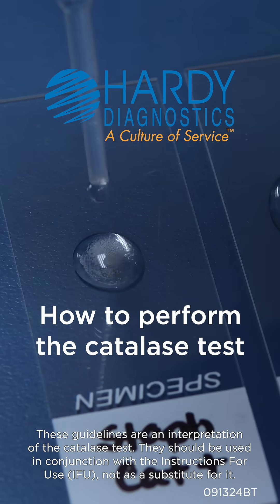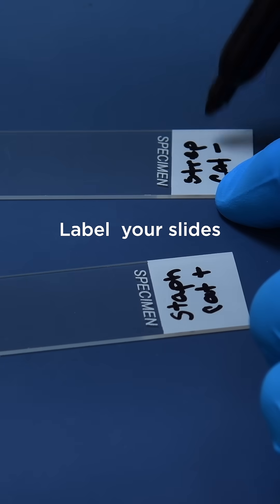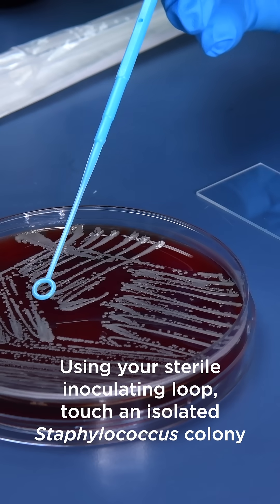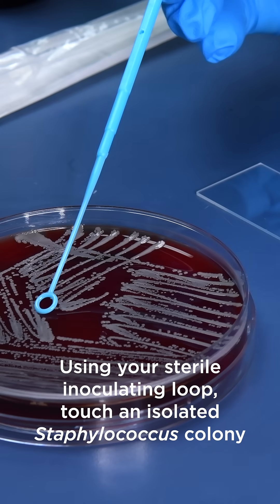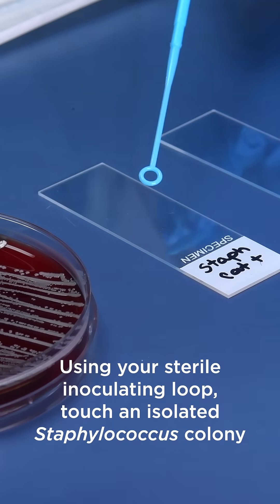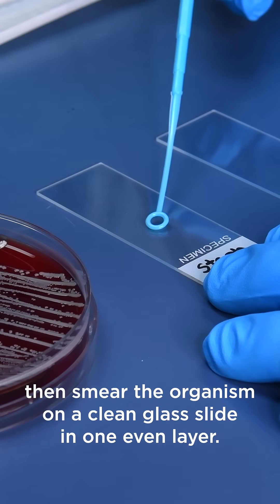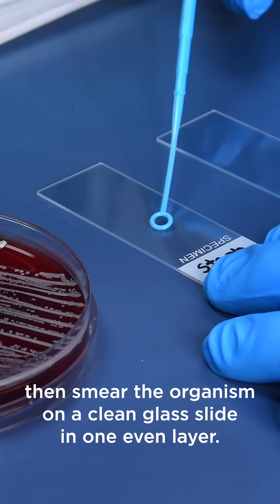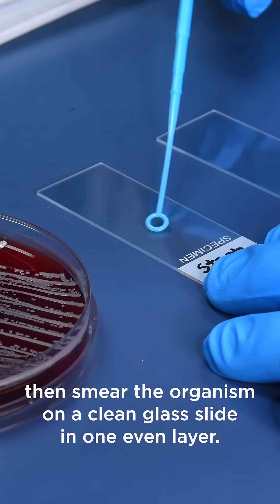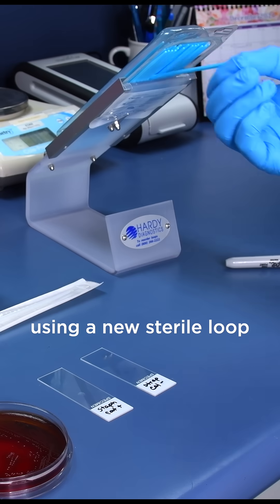How to Perform the Catalase Test. Start by labeling your slides. Using your sterile inoculating loop, touch an isolated staphylococcus colony, then smear the organism on a clean glass slide in one even layer.